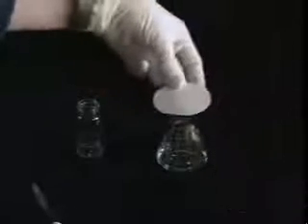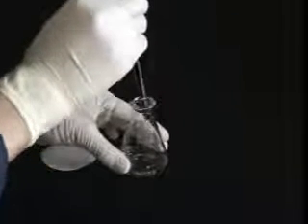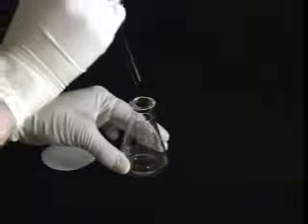If you forgot to set aside a seed crystal, you can also try dipping a glass rod in the solution, letting it dry so that the minute crystals form on the surface, and then dipping it back in.